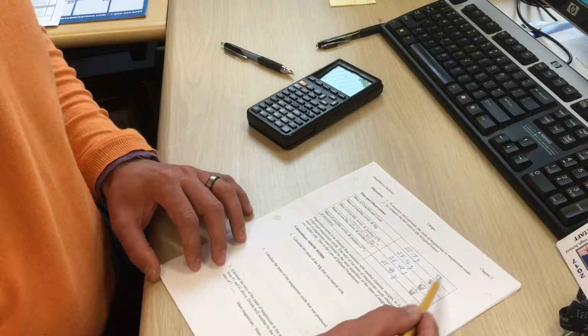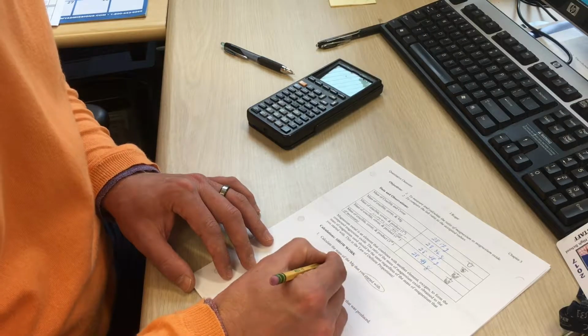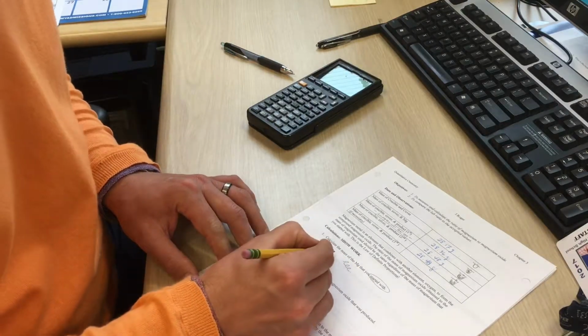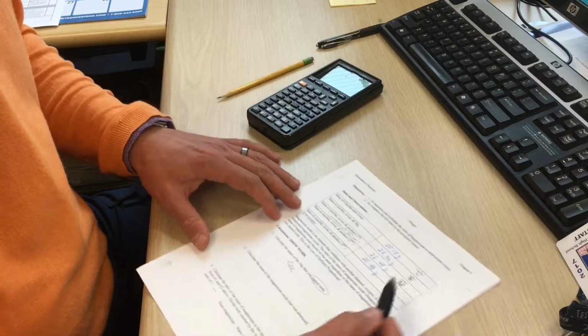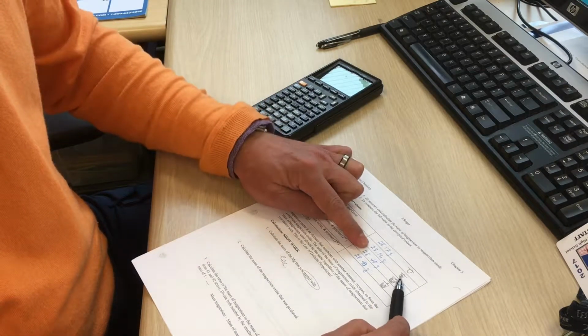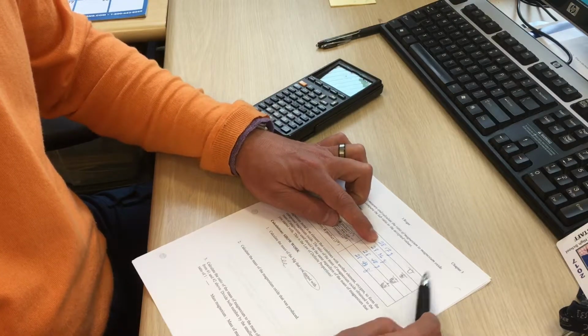From this data, we can calculate the mass of the magnesium that we started with. This is the little coil of magnesium, the 15 centimeter that we buffed and rolled up. Looking at our data, the coil in the crucible weighed 28.36, and the crucible alone was 28.17.